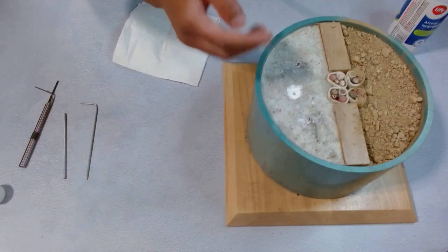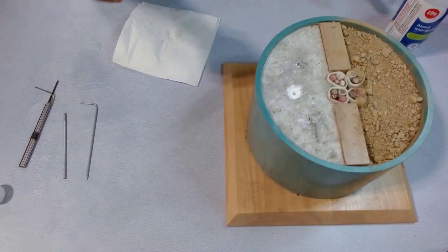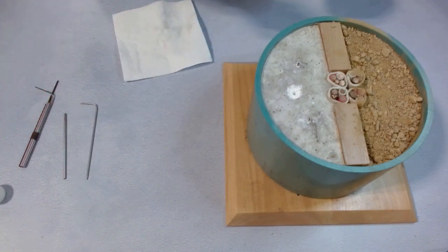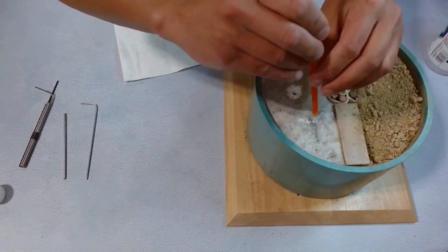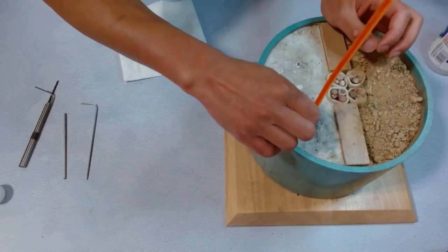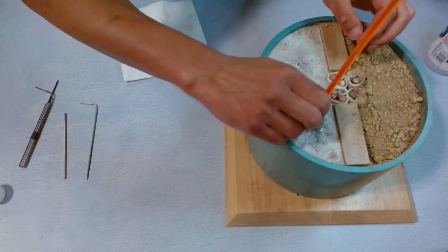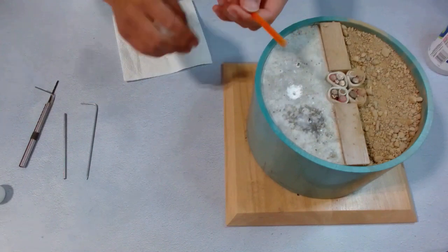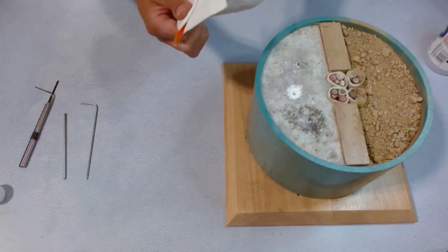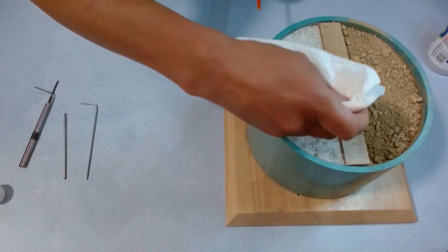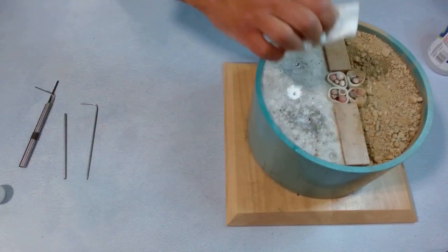Hold it tight and gently wipe it clean. Now we clean the needle sleeve in the concrete sample. Simply grab the pipe cleaner, dip it in the alcohol and dip it in the needle sleeve. Do in-and-out motions, twist a little bit for a few times and it will be clean enough. Now we wipe everything dry. Remove all the remaining alcohol so it doesn't go into the sample.